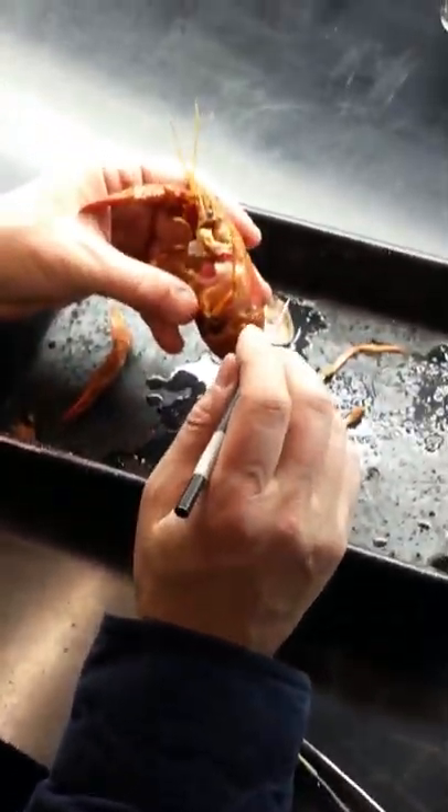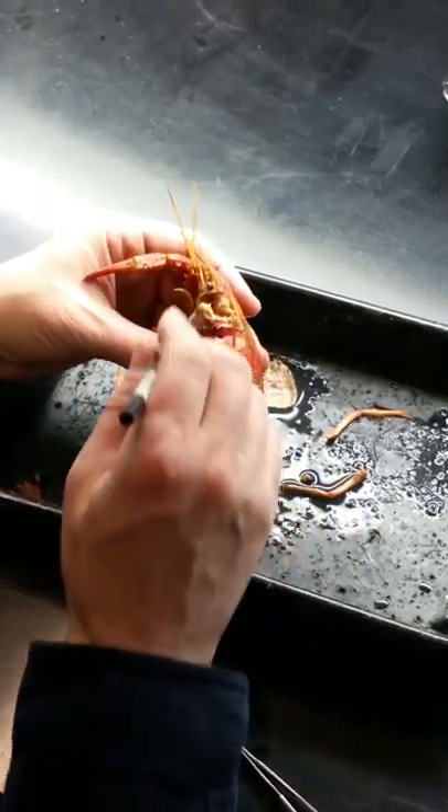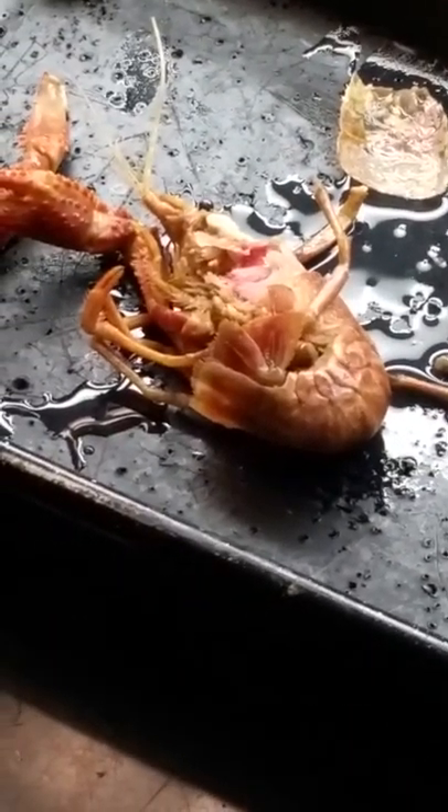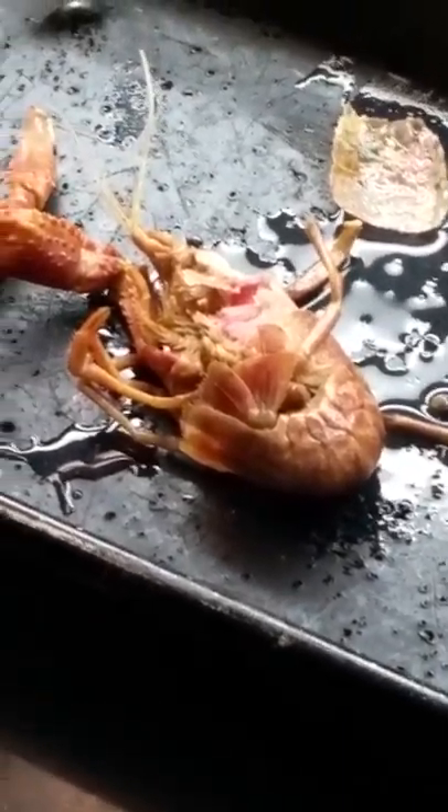Let me go ahead and explain some diagrams of the major internal organs, and then in the last half hour it'll be a sort of free-for-all for looking at mouth parts. I'll leave those there if that's okay — whose crayfish was this?